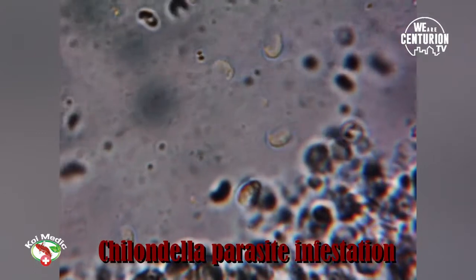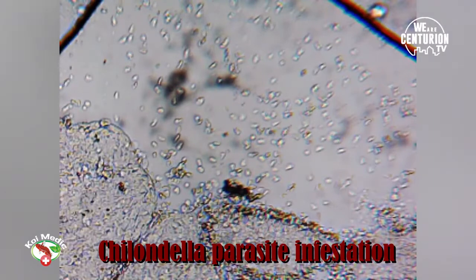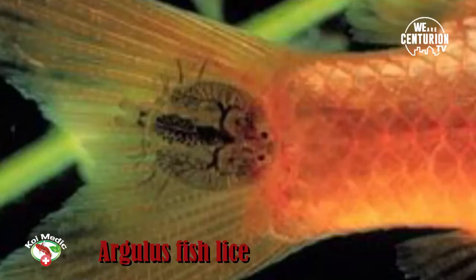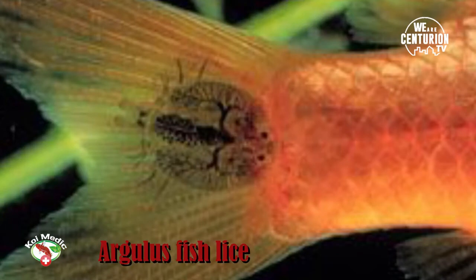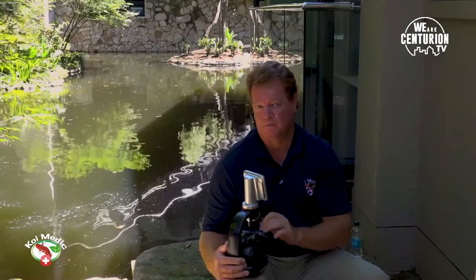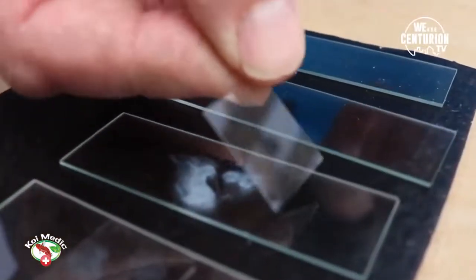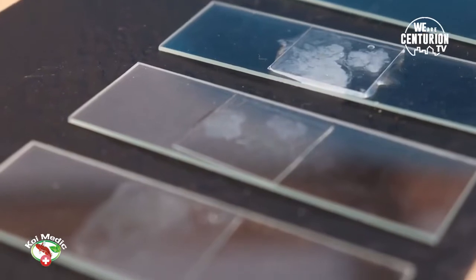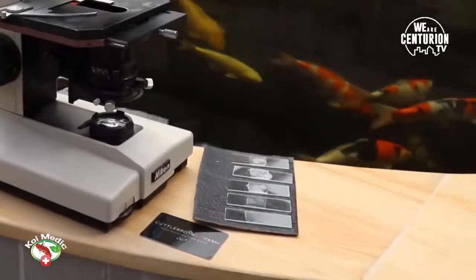So what is the difference between the first two slides and the third? A little technique I'd like to share: look in your koi pond and find the fish that is most compromised — the one that really isn't happy. Spend some time observing, then scrape that fish — specifically the gill filaments, the soft skin, and sometimes the side of the body. With a fish that is unwell, you are more than likely to pick up parasites. Once you've identified the parasite through the microscope — because you cannot see it with the naked eye — it's critical to do this before you medicate, because you need to know what you're medicating for. That can save you a lot of money.